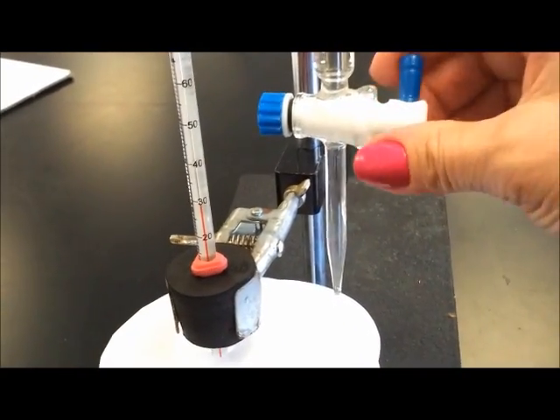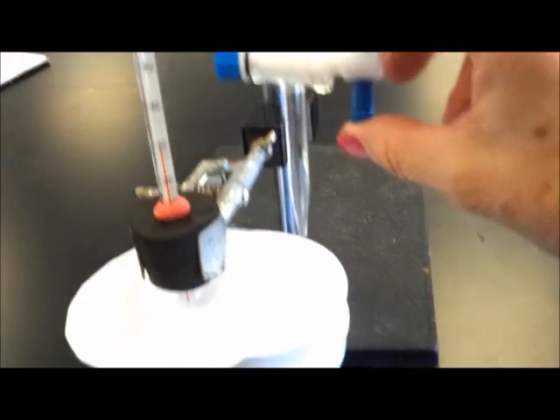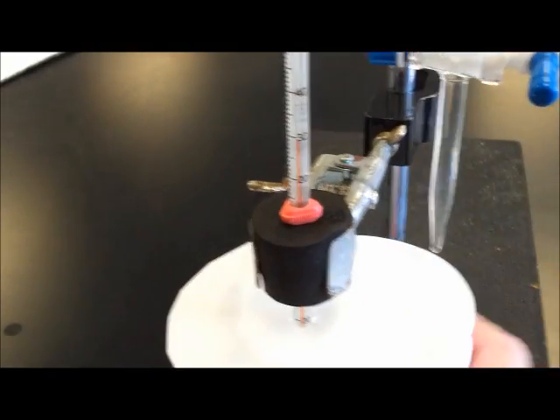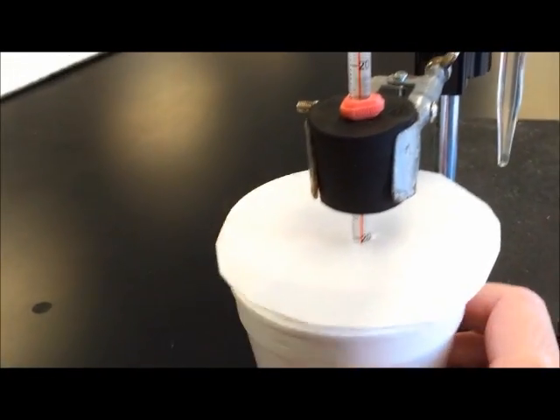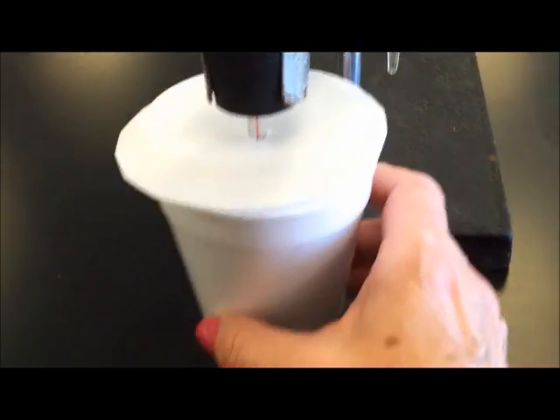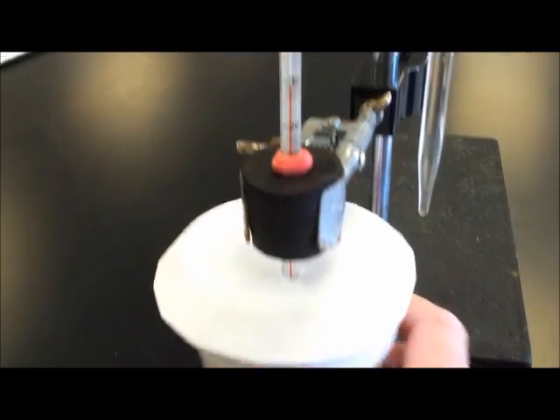Every single time we make a measurement, we have to wait for the temperature to stabilize. In the meantime, we need to swirl the styrofoam cups and be sure that it's covered by the styrofoam lid.